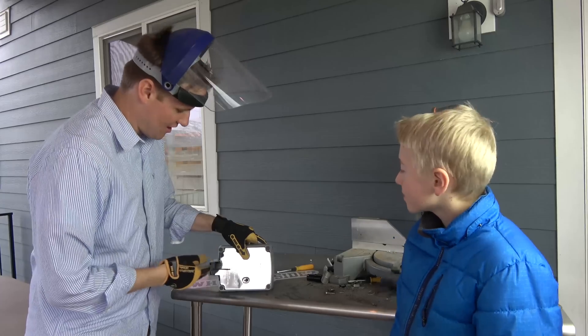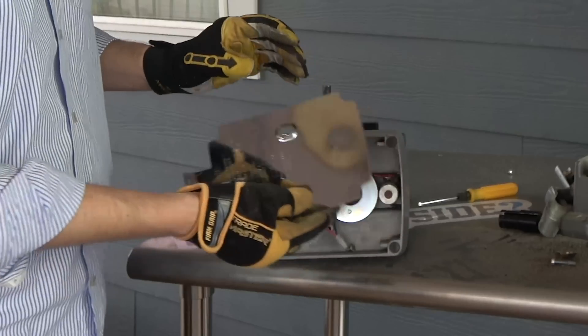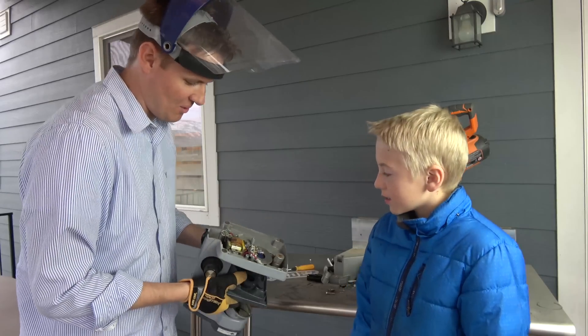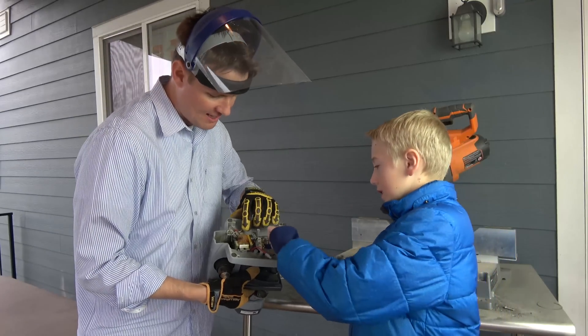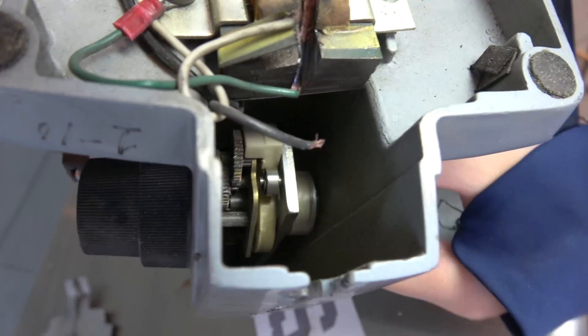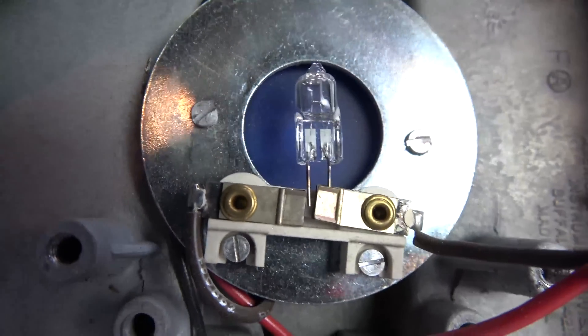This is good work. As I was cutting through this other side, I hit the bottom and it nudged the screws off of this guy. Success, success, success. Here's what it looks like on the bottom. It's cool. You can see all the motors inside of it. There's light, and you can see the light. Look down there. When this turns, it moves that. That little light is the one that powers it off.